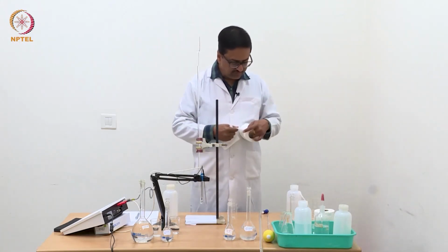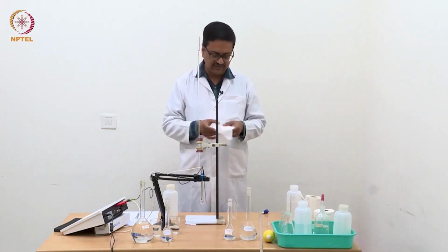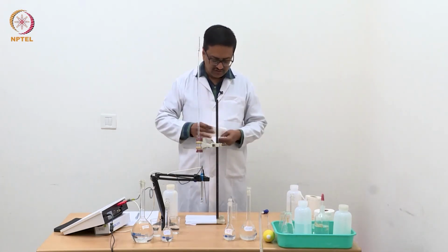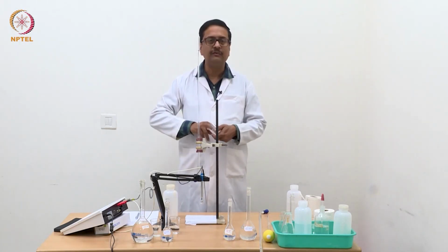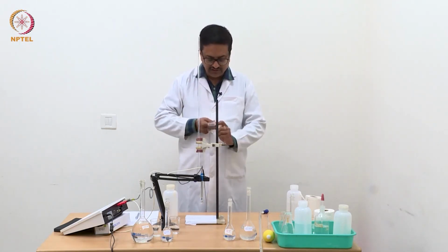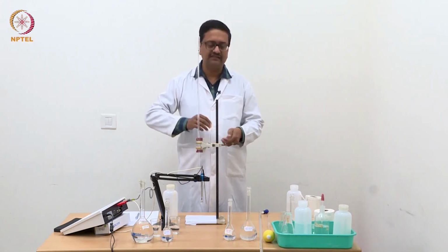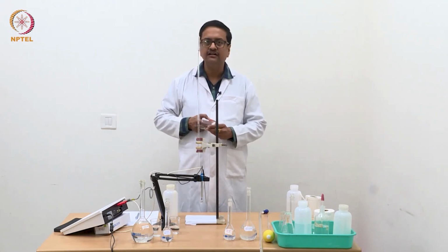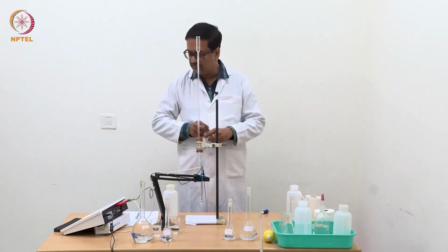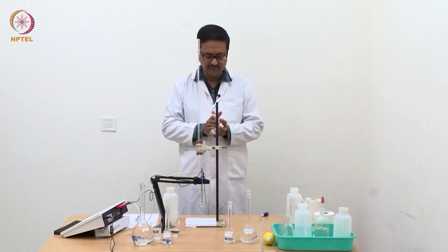In the previous experiment, I have shown you how to prepare a primary standard oxalic acid solution. In this experiment, I am not demonstrating that, but I just want to mention that you will need a primary standard oxalic acid to standardize the NaOH solution, which will be used to do the conductometric estimation of HCl.